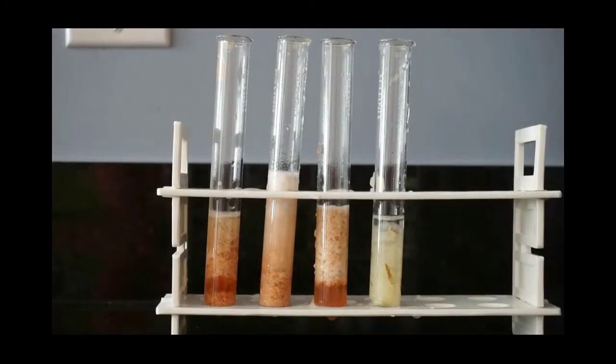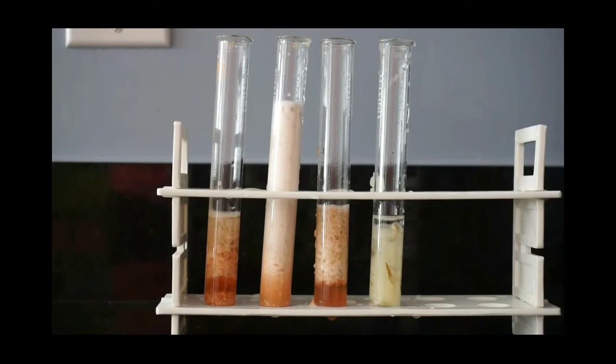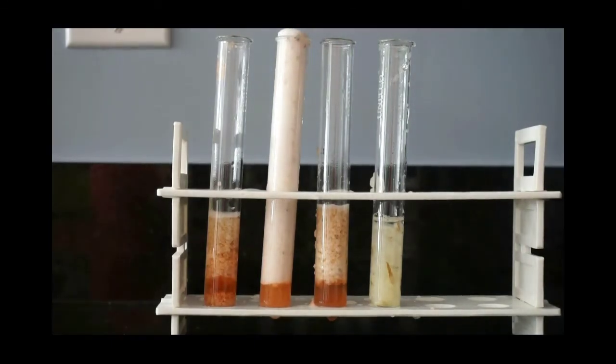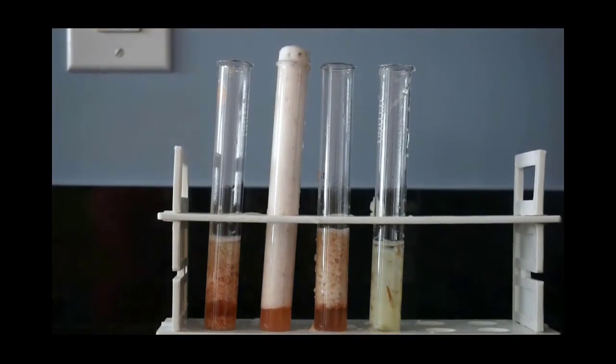I have this set about three times faster than it actually went, but you should see that tube number two begins to foam. You'll answer some questions about why that's happening. I would be very surprised if anything was happening in your other three tubes or cups, and you'll describe why that's happening in your discussion questions.